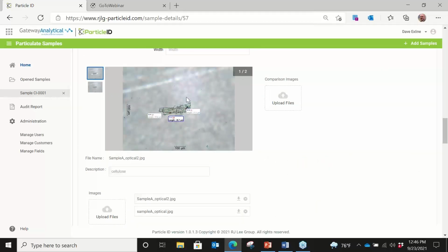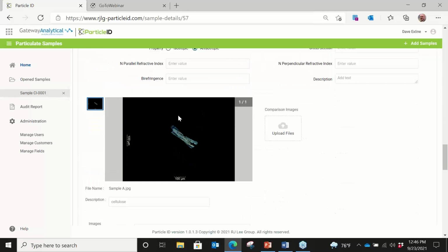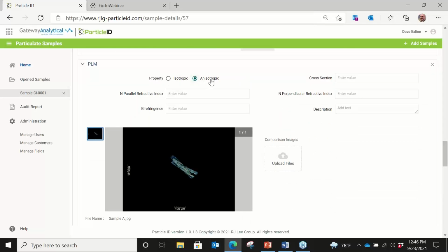We also have the ability to put in optical images. So we can put multiple optical images for a different particle. So this adds a lot of value because people training can look at this and they can look at what an IR spectrum looks like and what the Raman spectrum looks like and the optical pictures. Again, polarized light microscopy, which tells us this is an anisotropic particle.